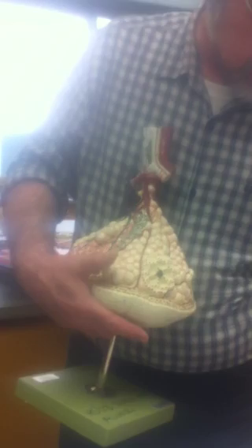So we don't have respiratory bronchioles. Don't worry about them. There's nothing to point out. So terminal bronchiole. So two, we're skipping. No respiratory bronchiole. Alveolus is one of these. Alveolar sac is a group of these.